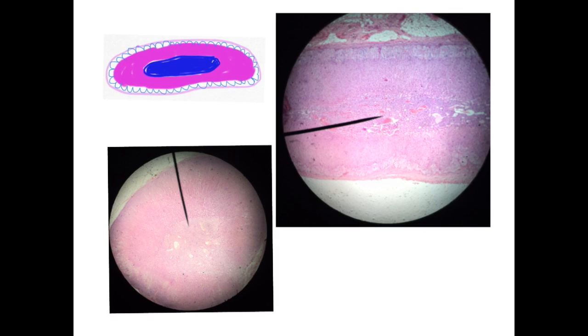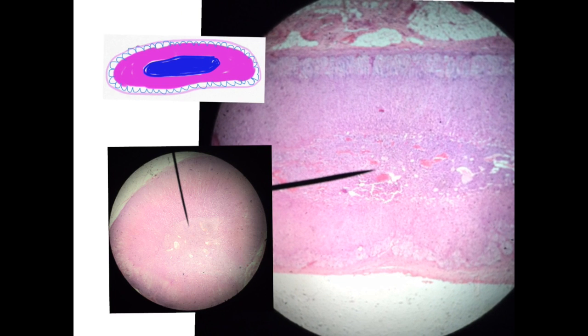Now, look for this oval structure, not necessarily so oval, but the most important thing is the appearance of this zona glomerulosa. Now I can make it bigger, and here you can see the zona glomerulosa, the arches of these pale basophilic cells. And these are the fasciculata, reticularis, and then the medulla, characterized by the presence of these blood vessels, slightly darkly stained compared to the cortex.